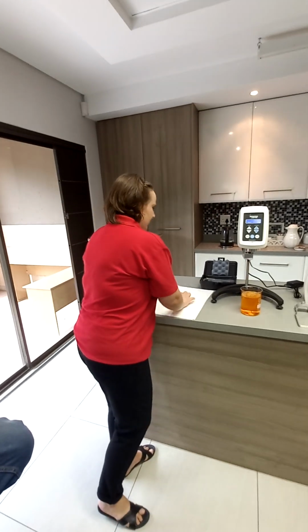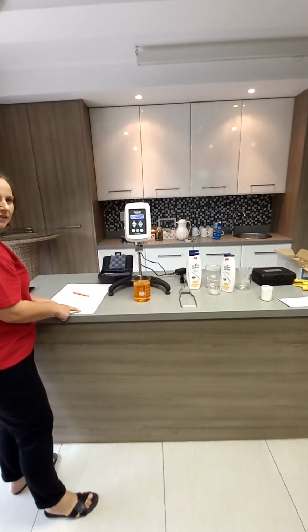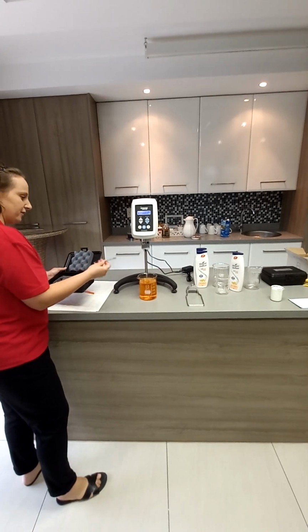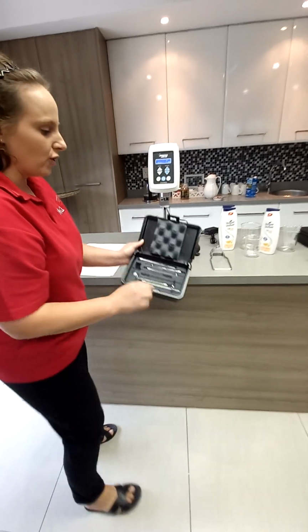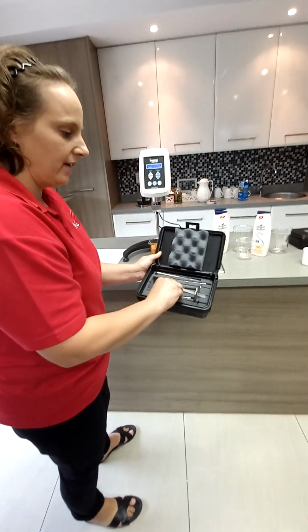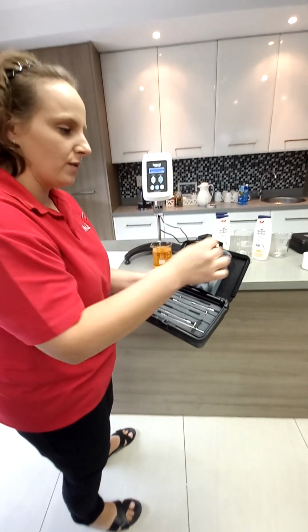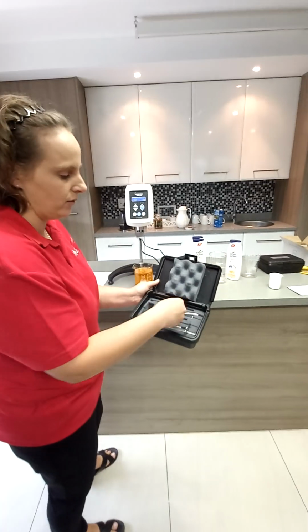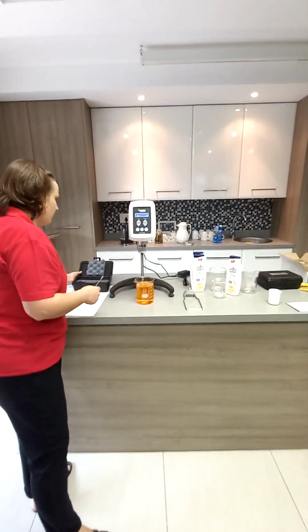So now we're going to test this viscosity. I want to see how it behaves. Again, a little bit of trial and error. I'm just going to choose spindle number 4. I'm taking the middle range. Your big spindle is for your lower end, your lower viscosity range. Your small spindle is more for the higher range, and then obviously all the in-between ones. So I'm just taking one in the middle, number 4.